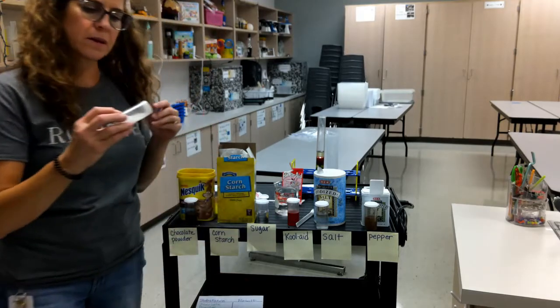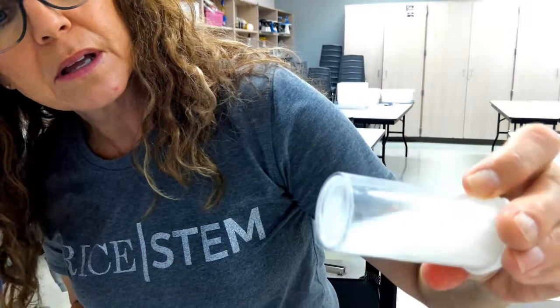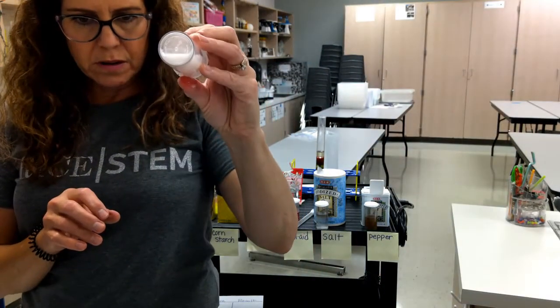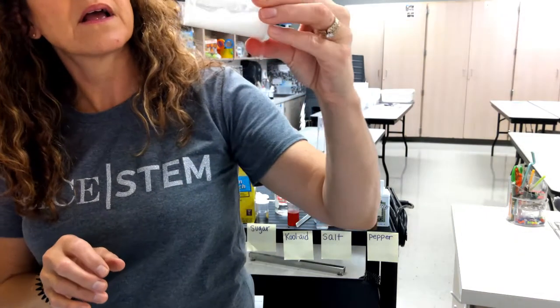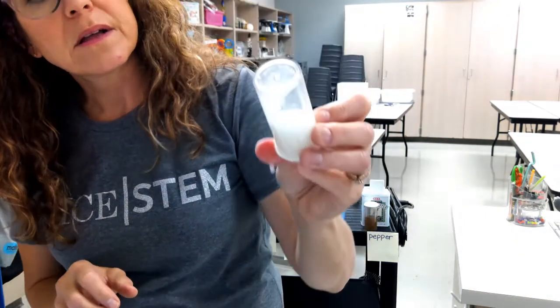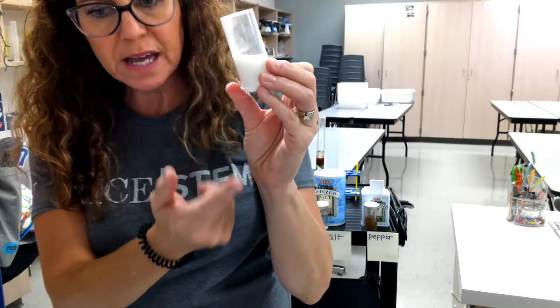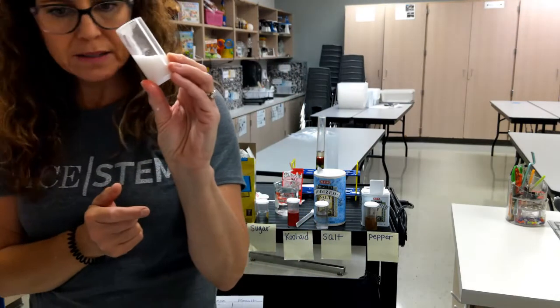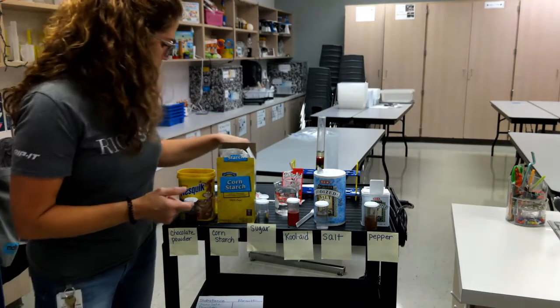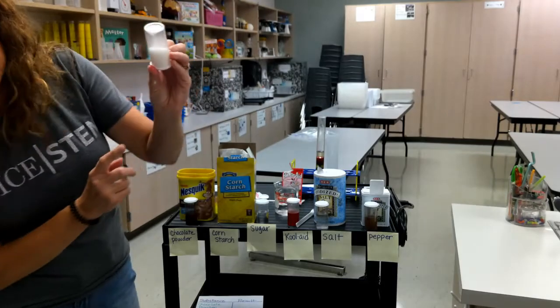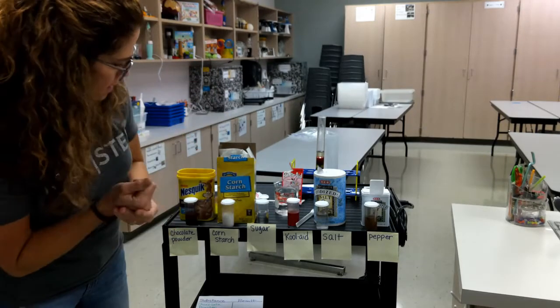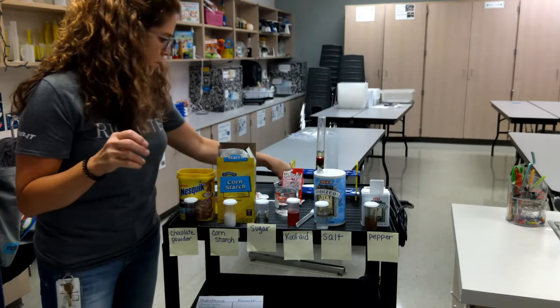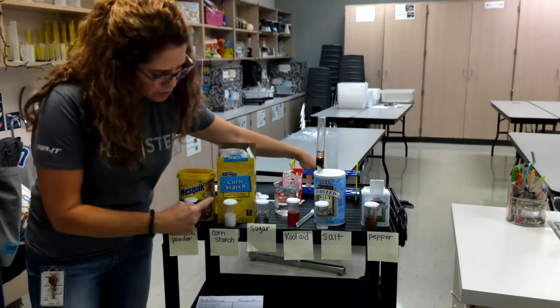Oh, look at this one. Do you see... This camera's not working very well. Can you see that there's white stuff along the side? Do you see that powder? So it did not dissolve in the water. There's white powdery stuff that's left on the side. And apparently that lid's not on tight because it's leaking everywhere.